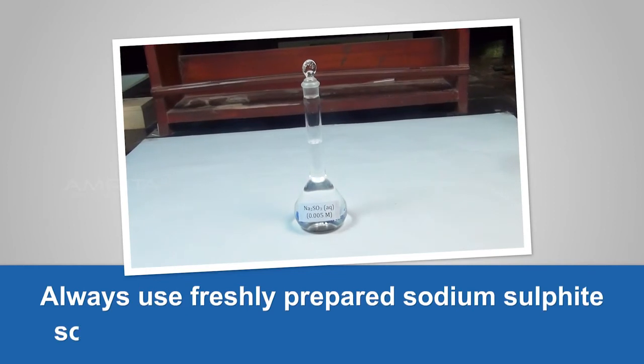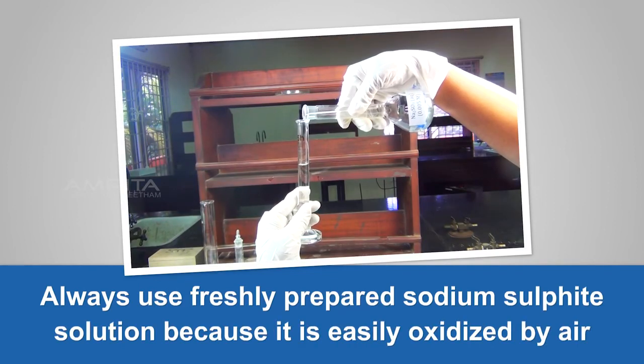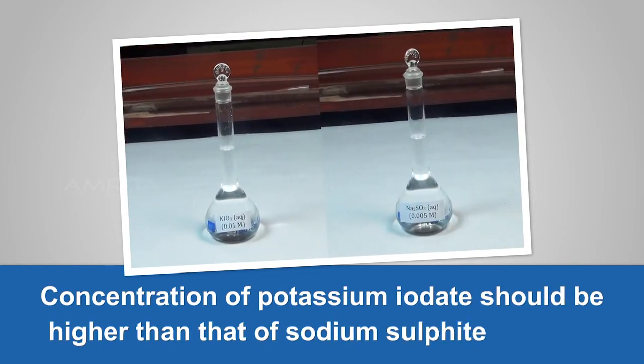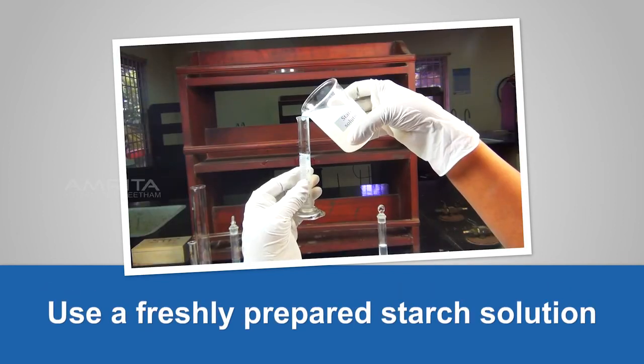Precautions: always use freshly prepared sodium sulfite solution because it is easily oxidized by air. Concentration of potassium iodate should be higher than that of sodium sulfite solution. Use a freshly prepared starch solution.